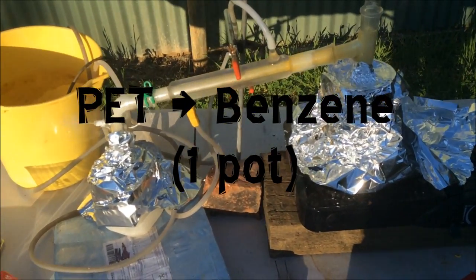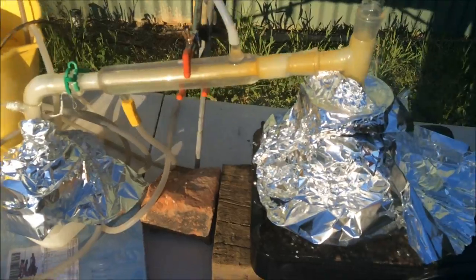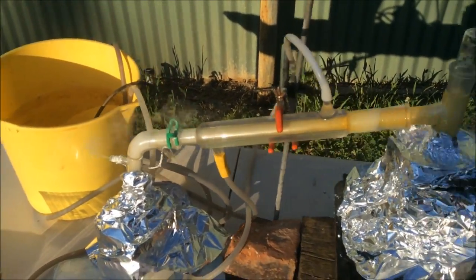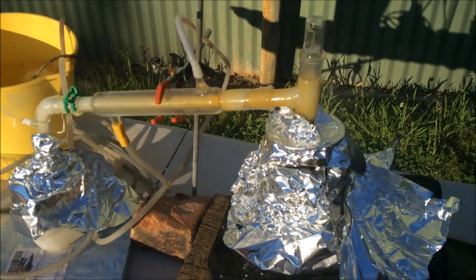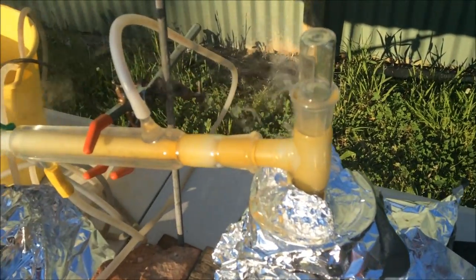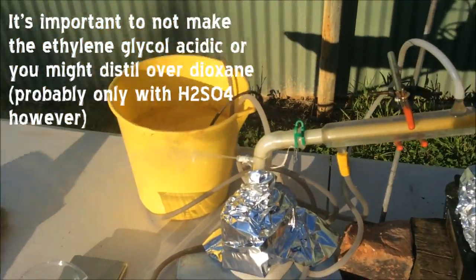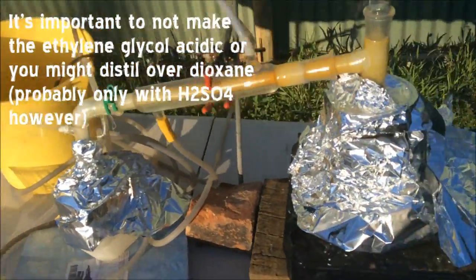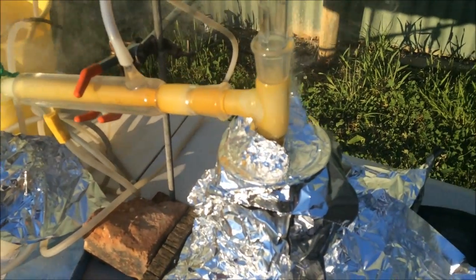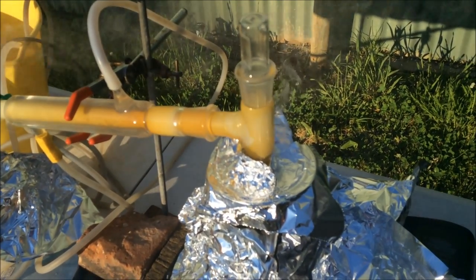It's only been started and very quickly we can see it's actually working. There's a yellow liquid coming off — I'm pretty sure that's the yellow benzene from this reaction. Bad news is it smells dreadful. There's heaps of white smoke pouring off as I sort of expected. Unfortunately this joint has sprung a leak and I'm trying desperately to plug it, but I don't have any Teflon tape. I should really abort this and fix it, but hopefully I don't cause a huge benzene fire from this leaky joint — no promises.